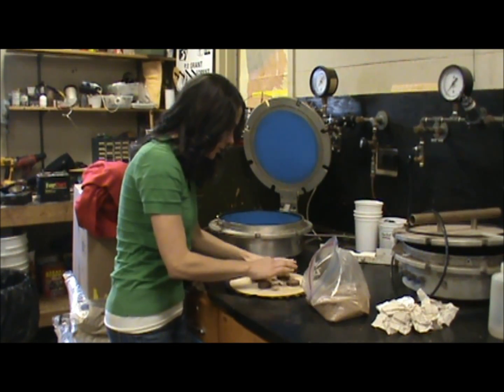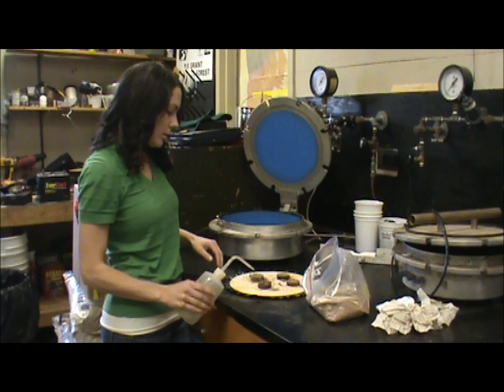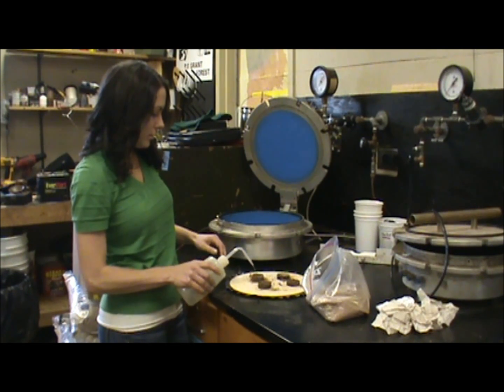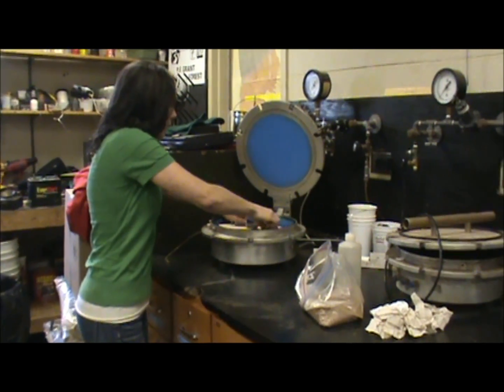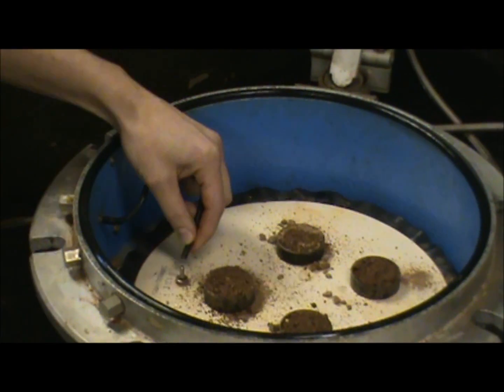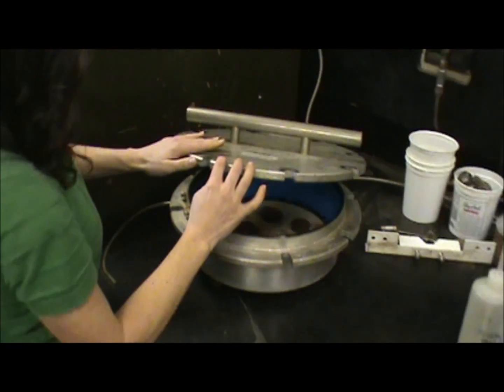Once you've got them all filled, you're going to take the same solution that we soaked the plate in — the calcium chloride — and you're going to saturate the core. Then we take the plate and we place it down in the bottom, and you're going to connect this hose. It's going to push out the water that we have inside the plate and inside our little mini soil cores. So you shut them.